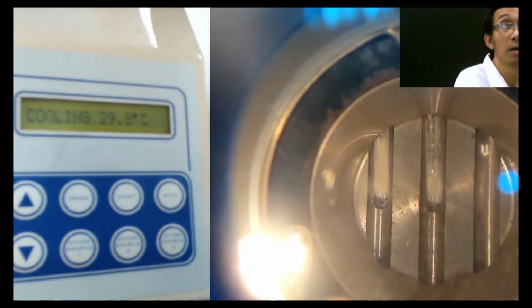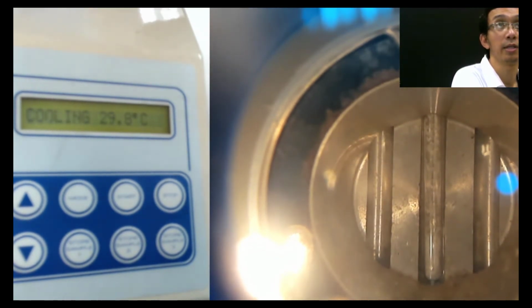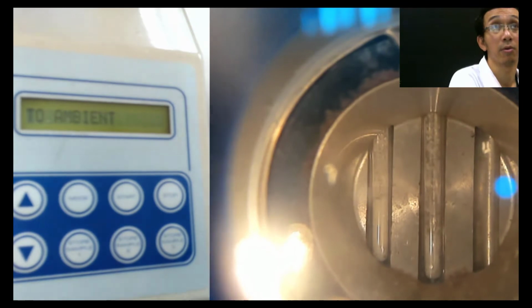Okay, you see this is the middle one. So I go down. So this one is the Y. This is Y. The middle is the X. So I go down, go down.